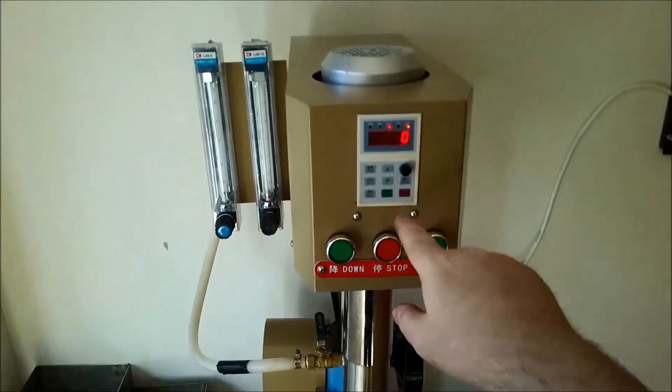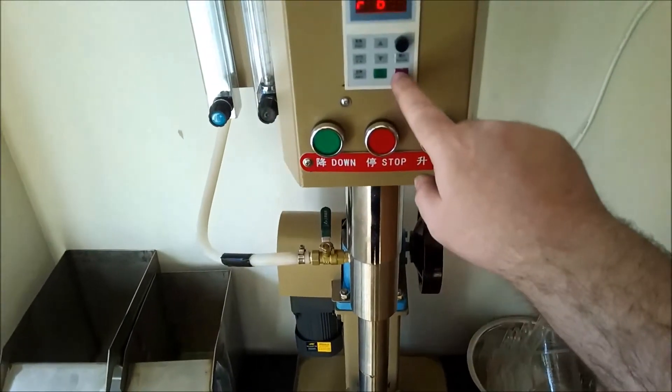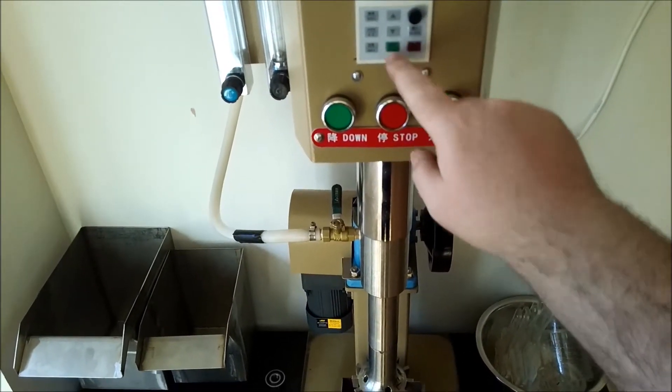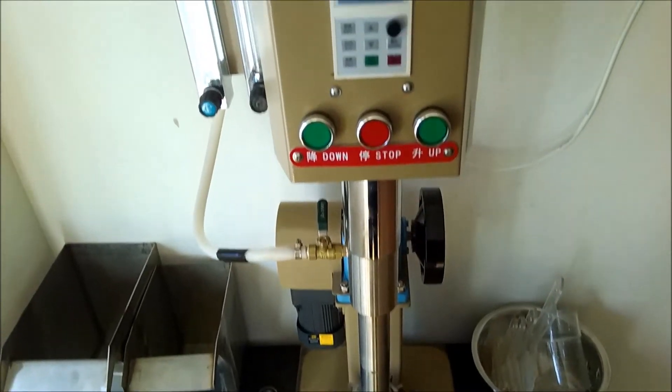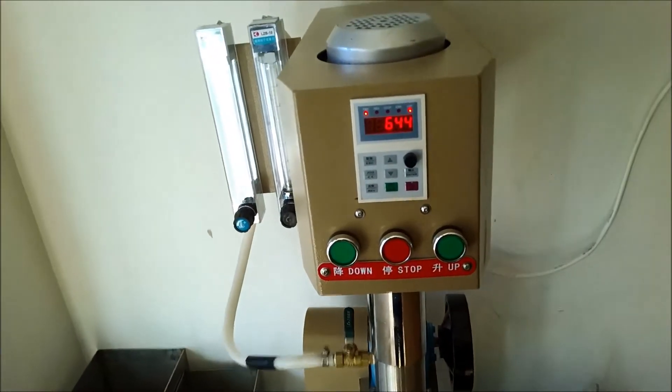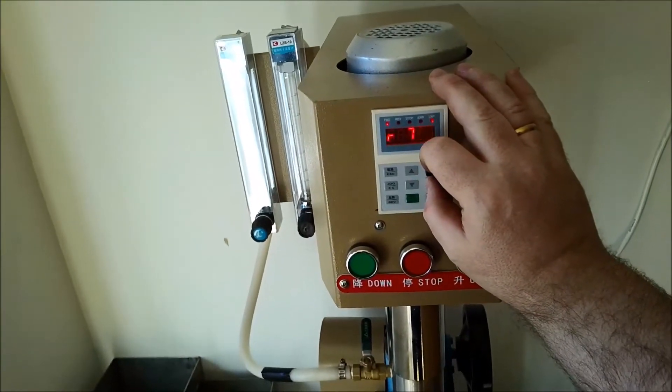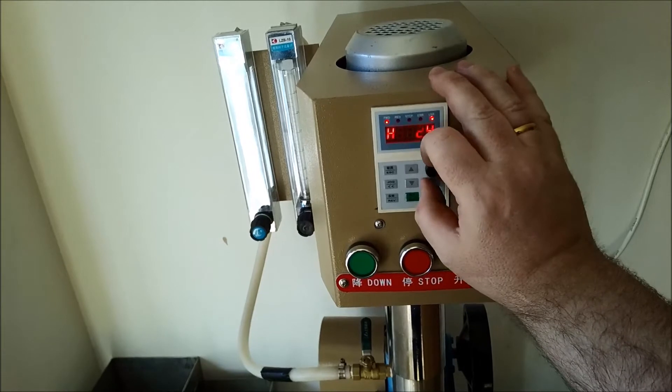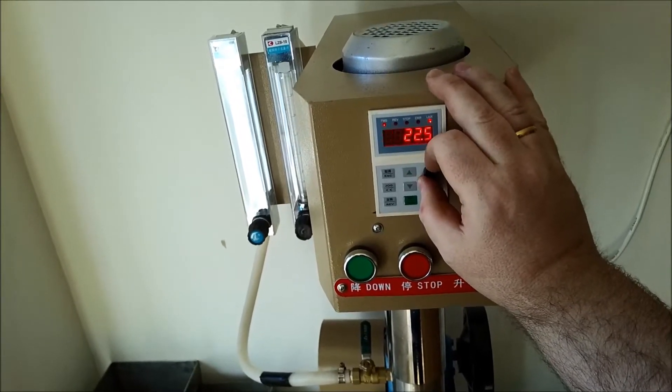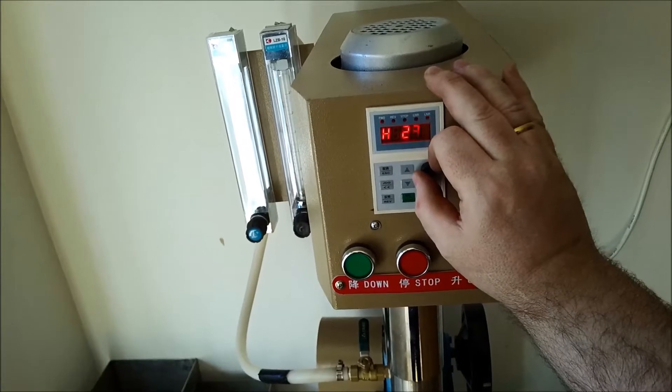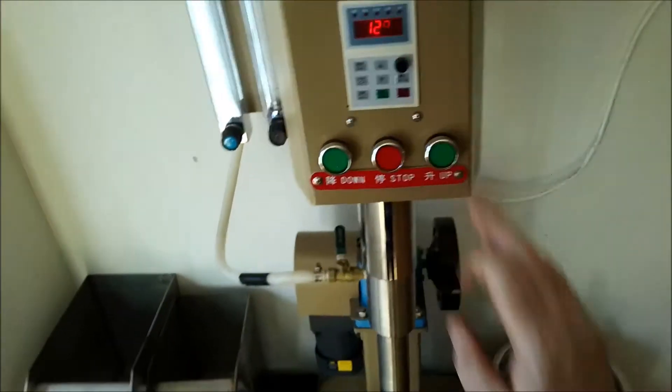I'll start it just for a test. Okay. We're at 644 RPM. 828. 1300. So that would be a good rougher test.